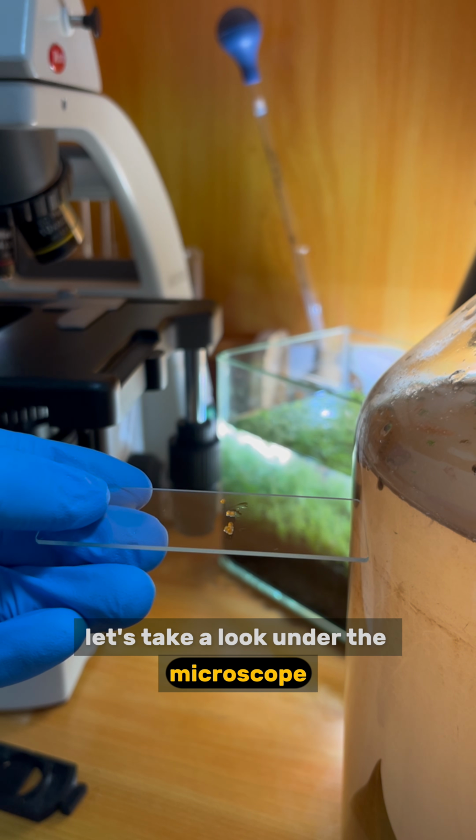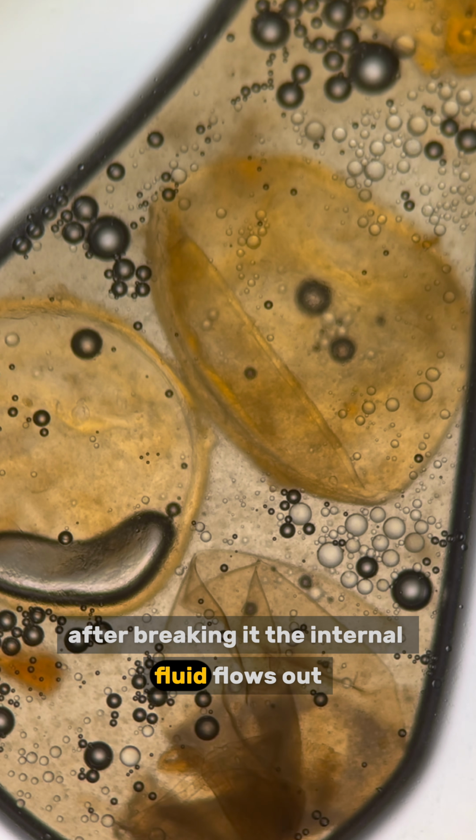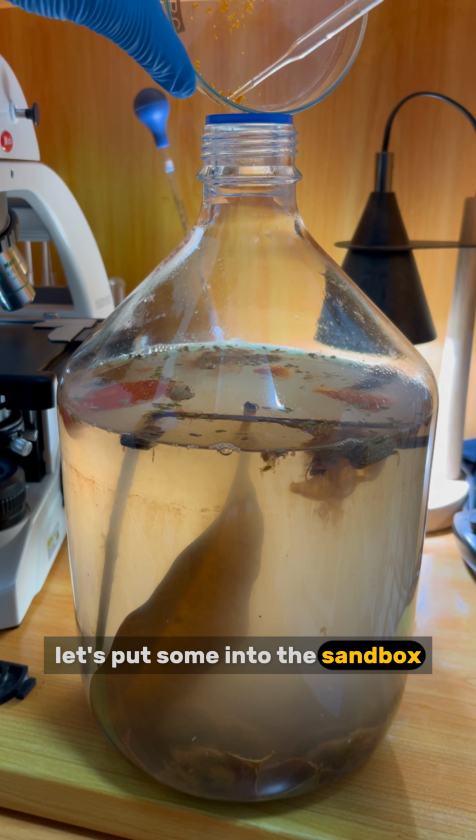I bought some fish roe. Let's take a look under the microscope. I can see it is empty inside. After breaking it, the internal fluid flows out. Let's put some into the sandbox. That is all for today.